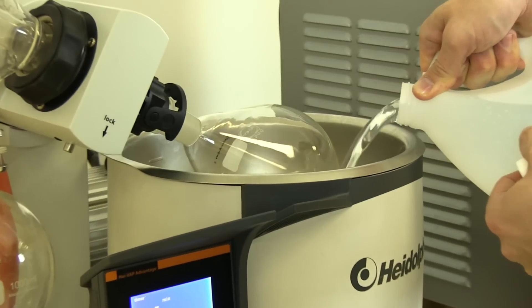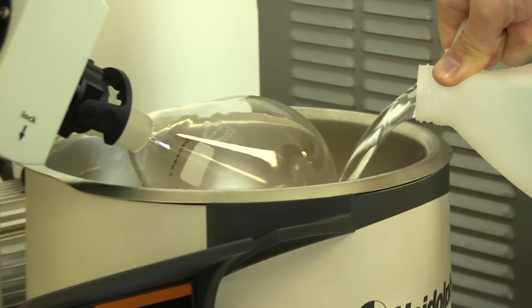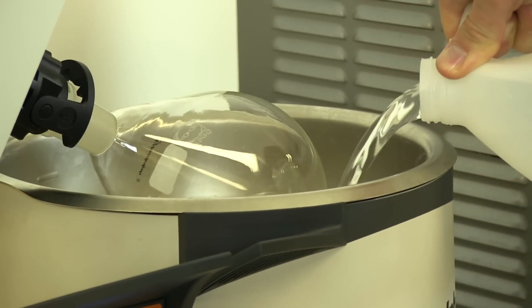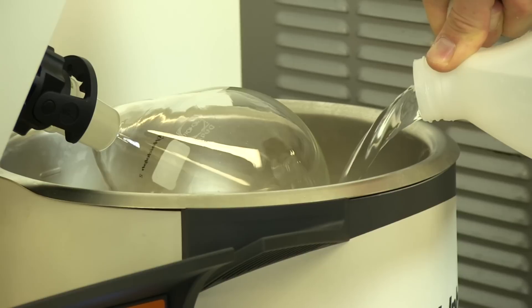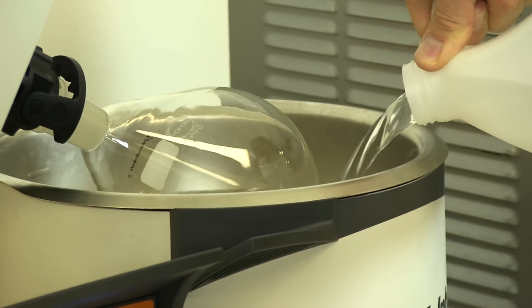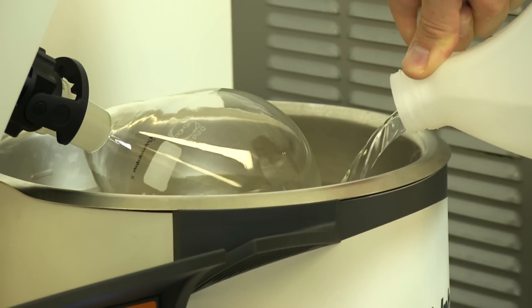This can be distilled, this can be tap water, really has very little effect on the process except that this bath does heat and will gently heat the evaporation flask.